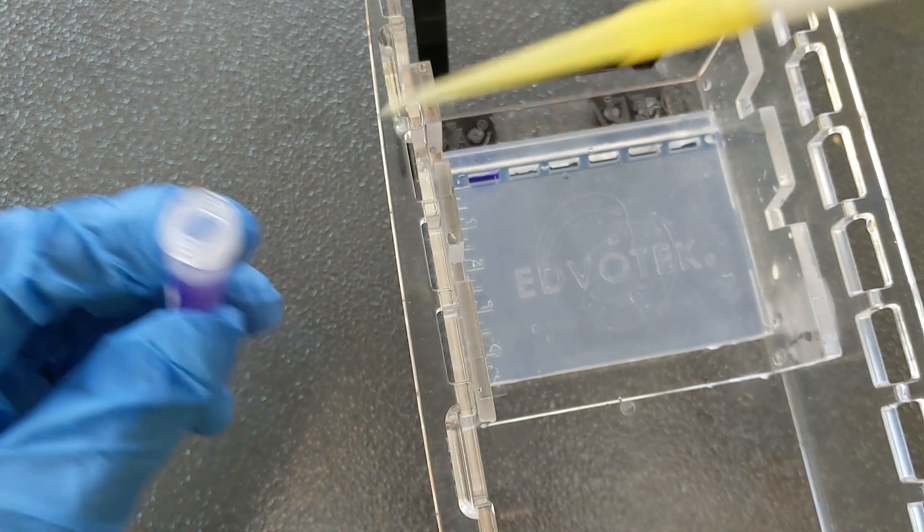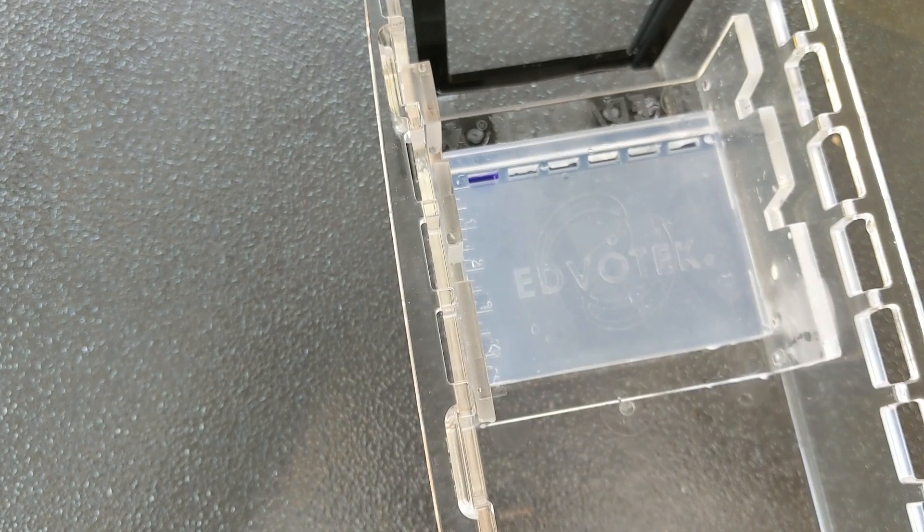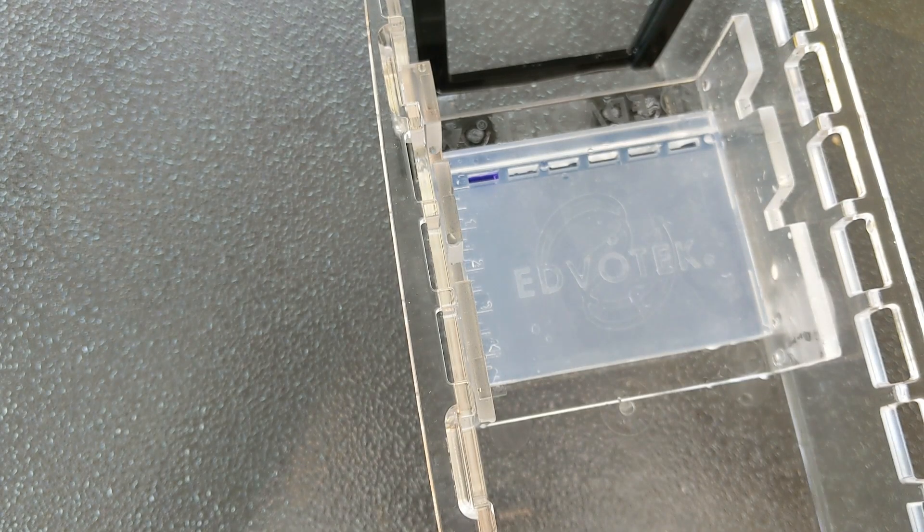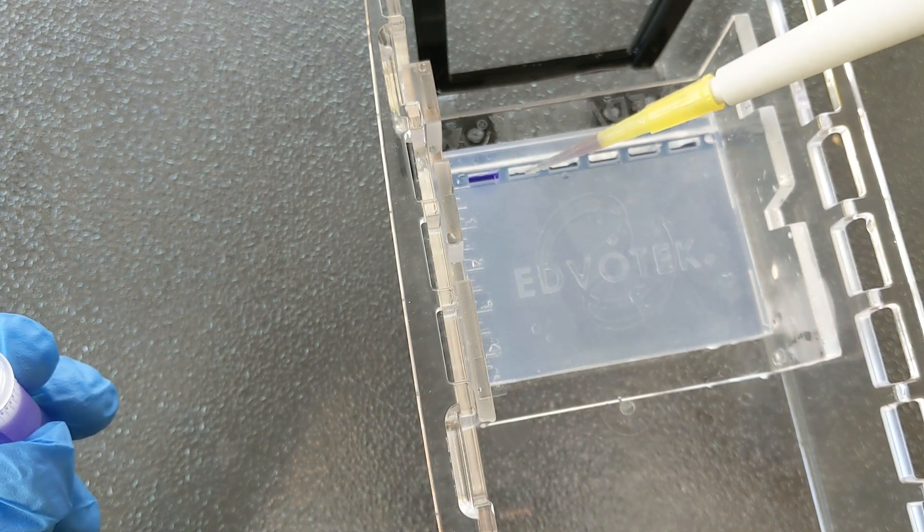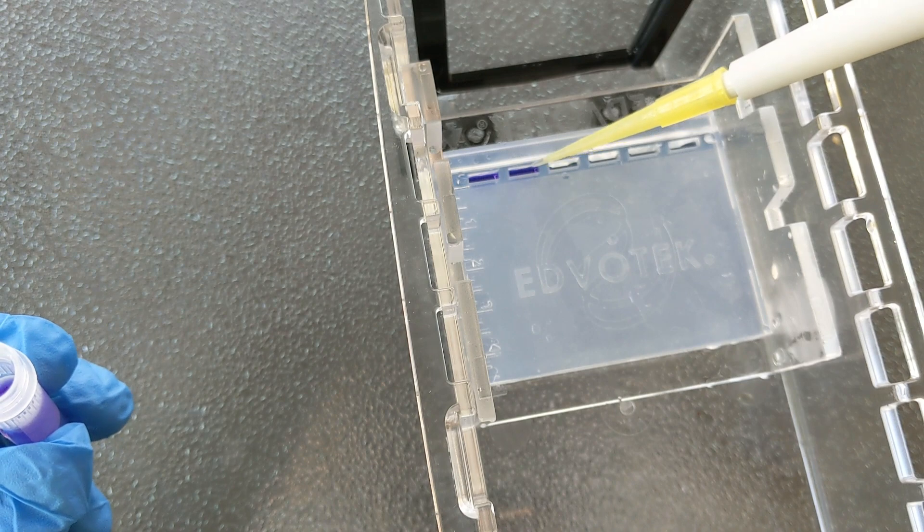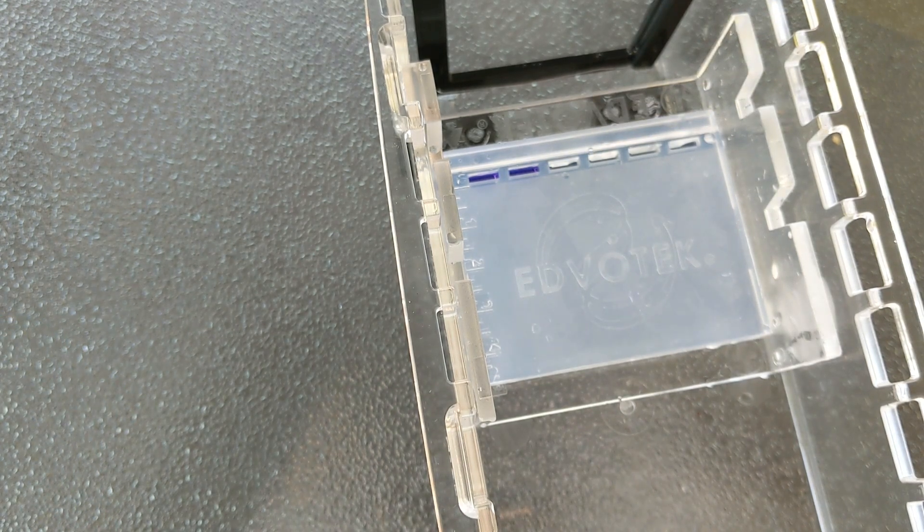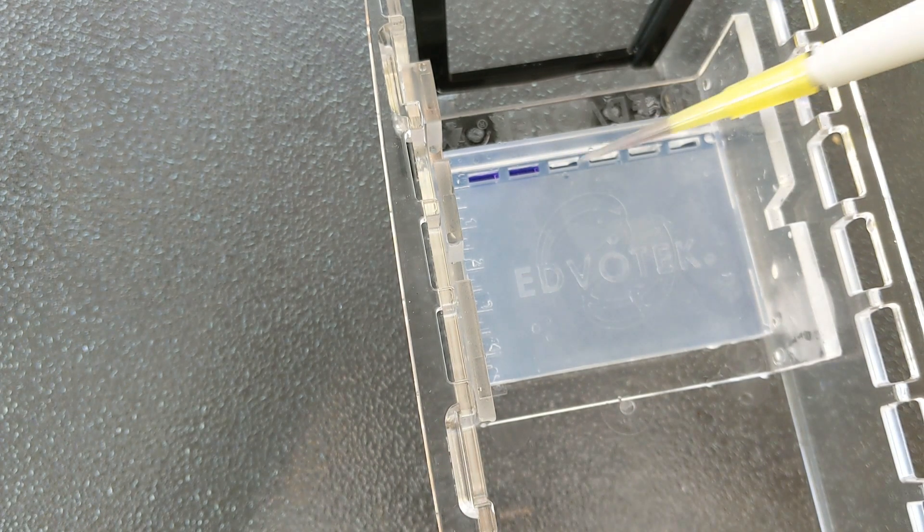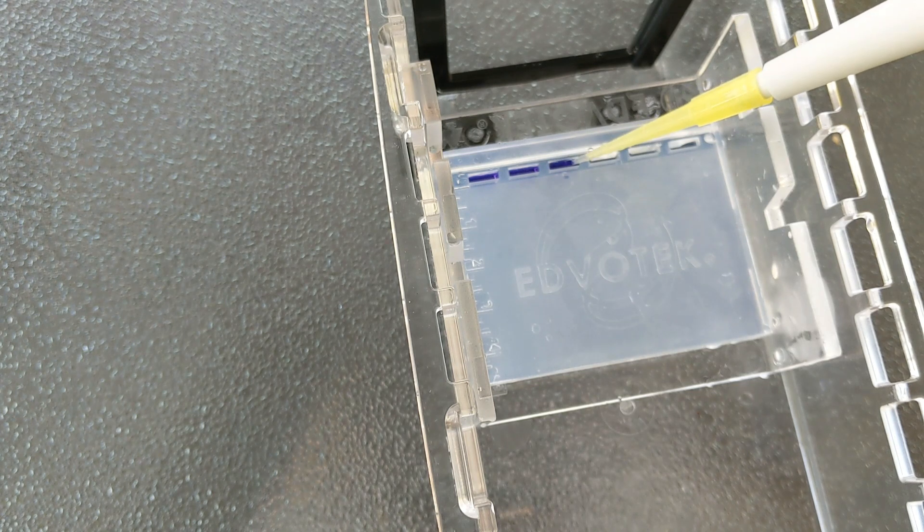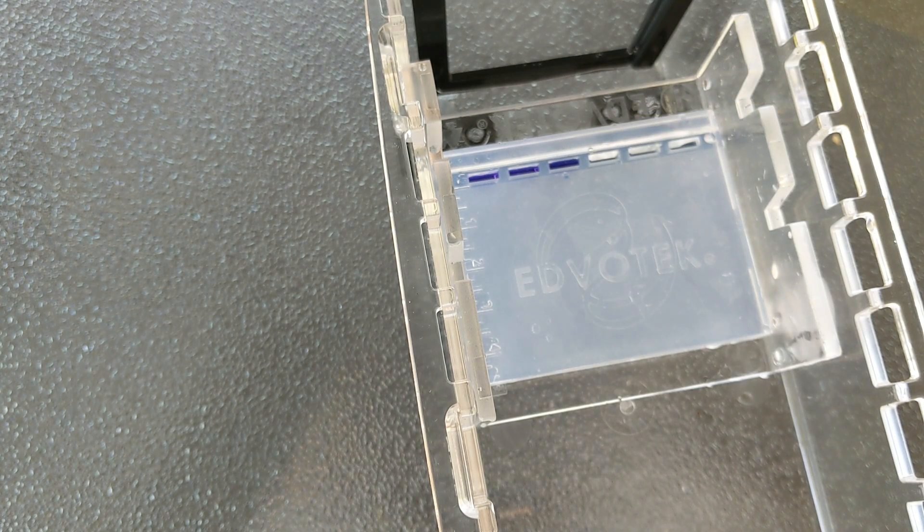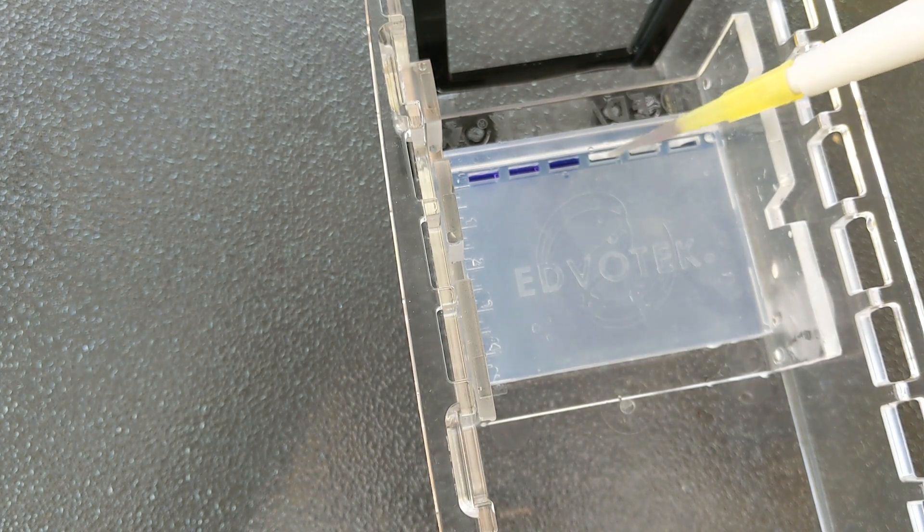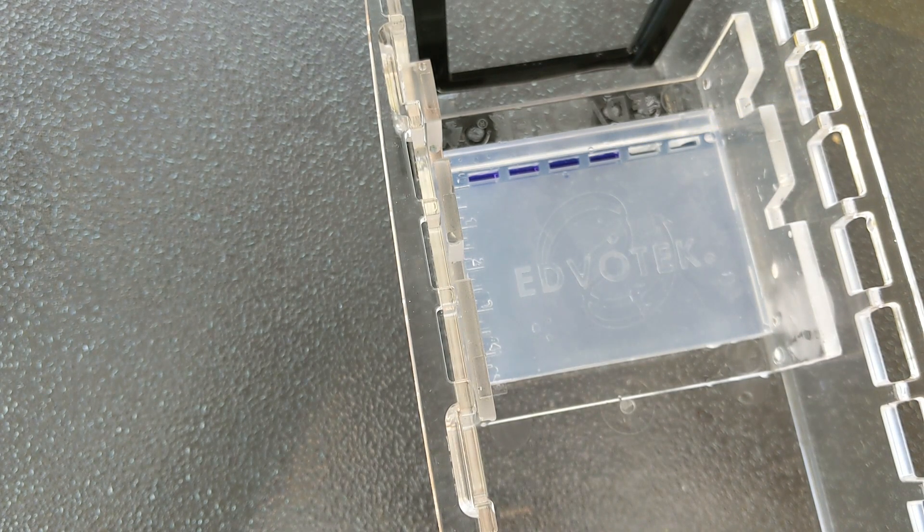The idea is you don't have the buffer in yet, so the gel is dry when you're adding the DNA samples. And these samples are loading beautifully. I would say based on my demonstration, you're probably all going to decide that wet loading is trash and dry loading is the way to go. And you might be right. Dry loading is pretty simple.